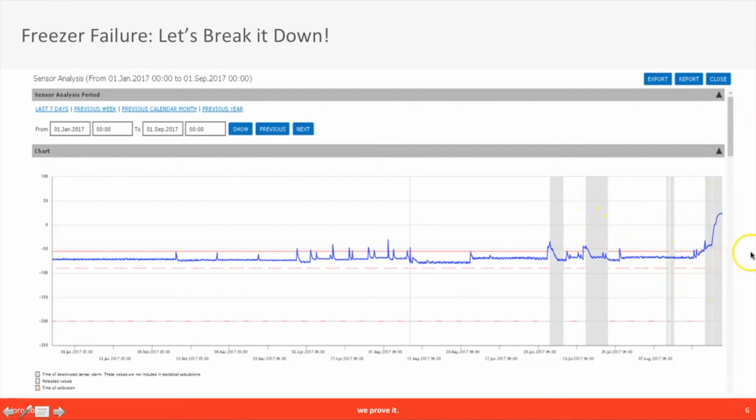Now you see where the freezer ultimately fails and stops functioning altogether. But in this case, our user took advantage of the monitoring system functionalities. They used data analytics tools, set up automated sensor analysis reports, and warnings and alarms. At the end, they were able to remove samples before the freezer failed completely, thus ultimately saving priceless research.